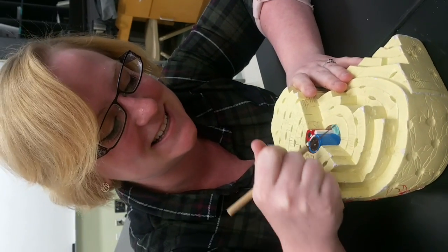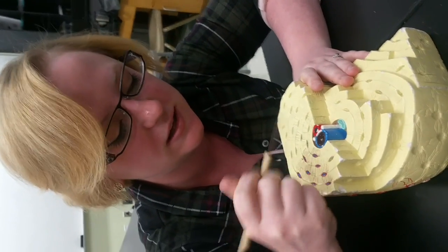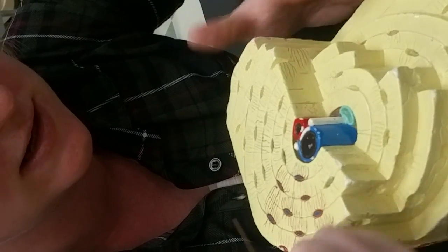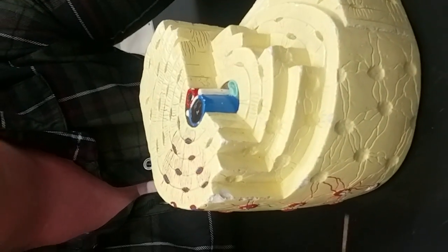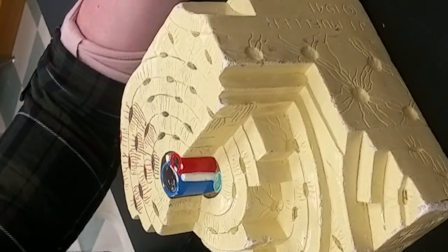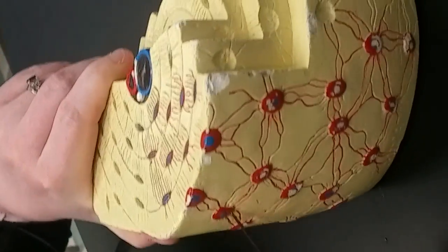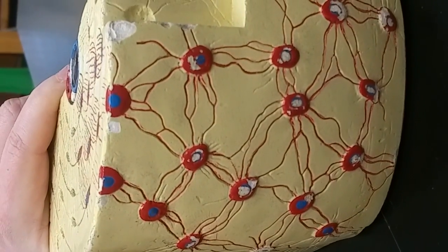And like I said, it's getting stuff from the central canal. And in the central canal, we have these arteries and veins and sensory stuff and some lymph as well. But that's just like the center of each osteon, you're going to find one of these. So yes, bone is vascular. What did you know? And I believe I have covered all the terms, but one more thing I want to show you just real quick is here is just a side view of those cells, just so that you can see that yes, it is indeed an entire cell. That's it.